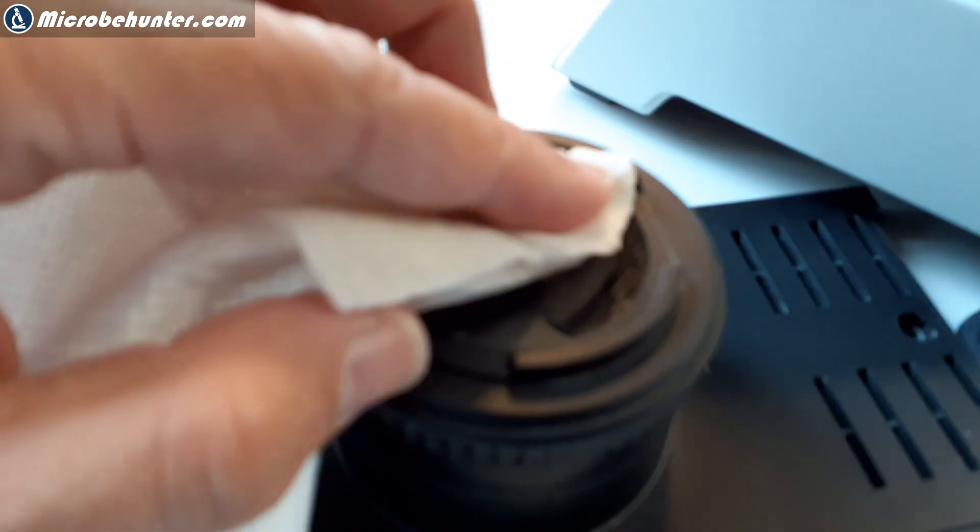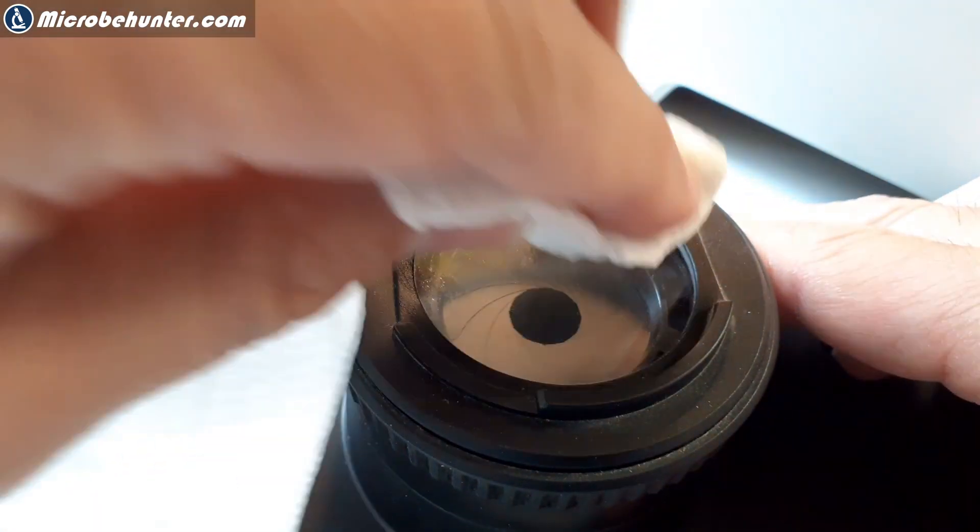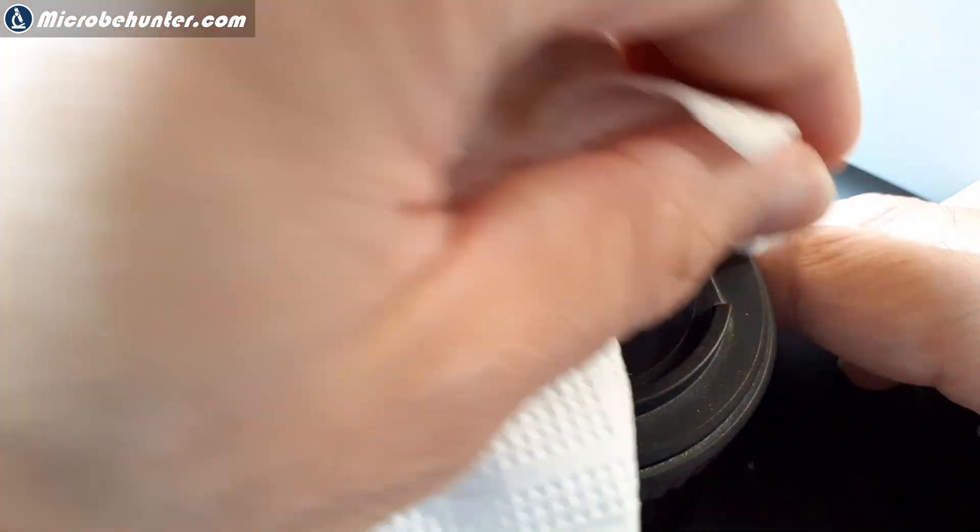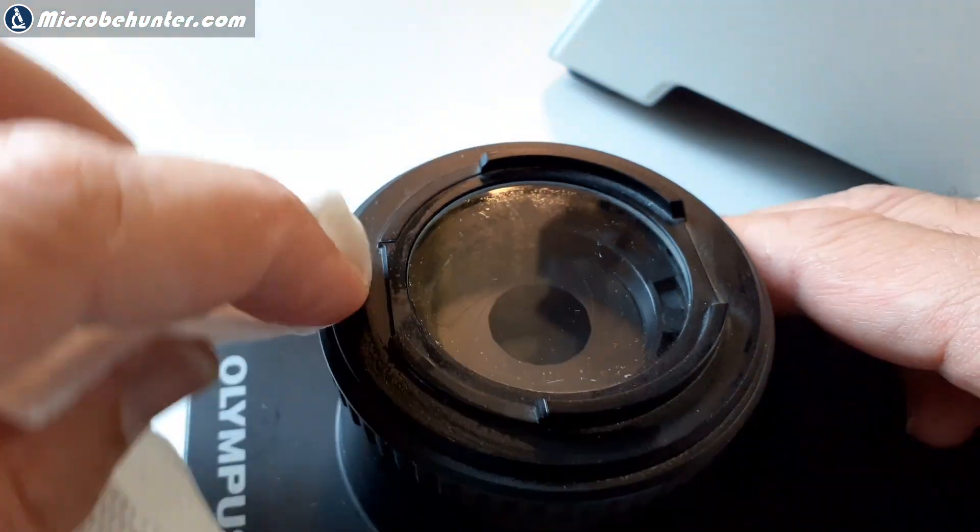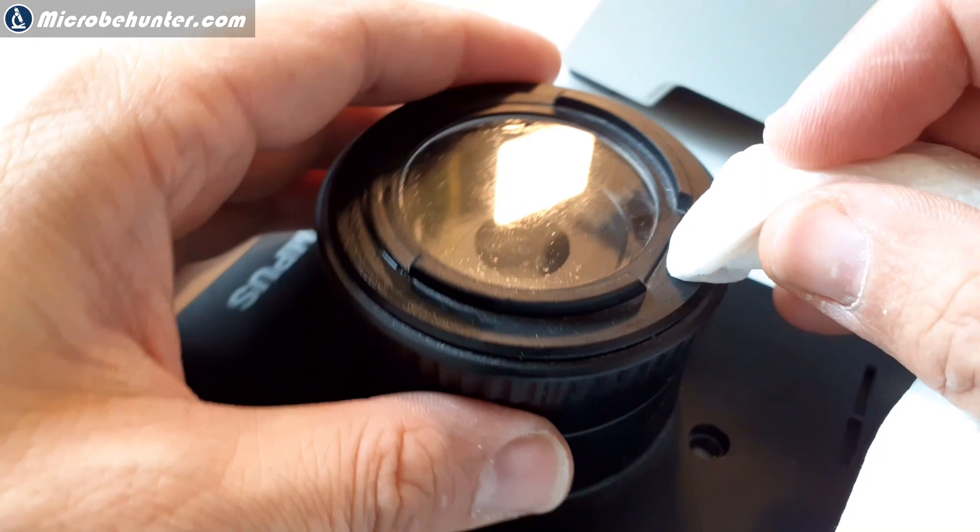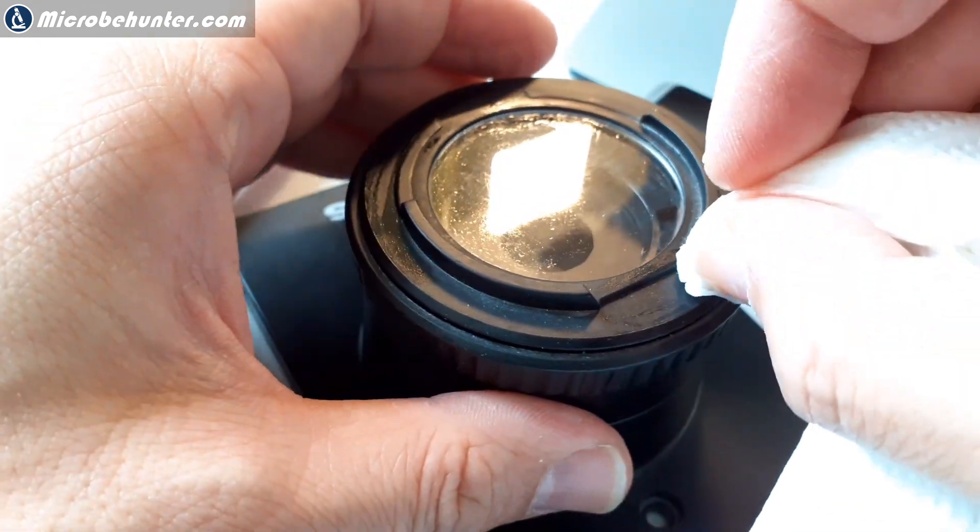So first of all, I used some wet tissue paper to remove all of the big stuff, so to say. But of course, this did not improve the situation a lot. Because the dirt was located inside.